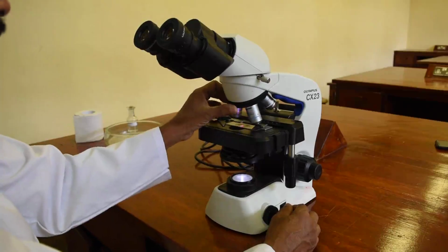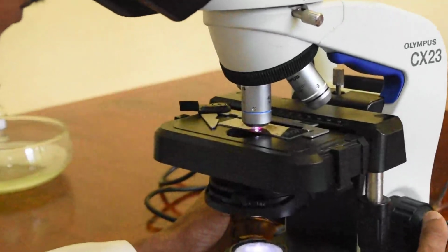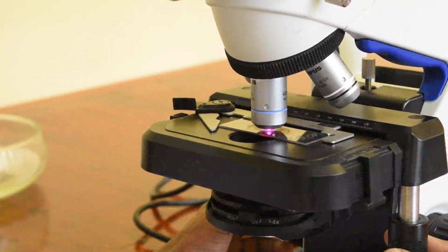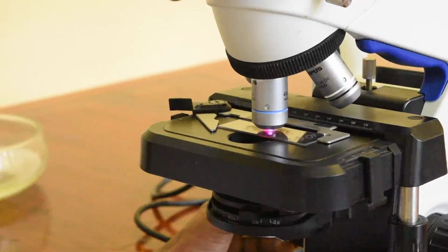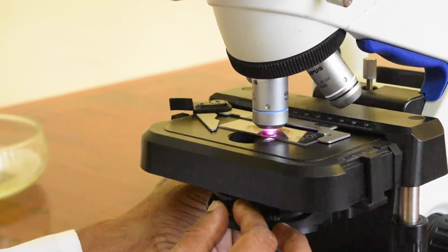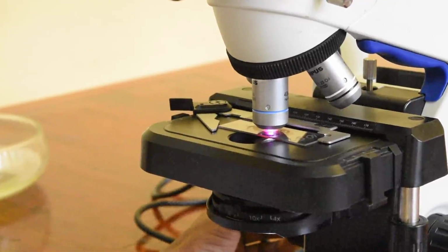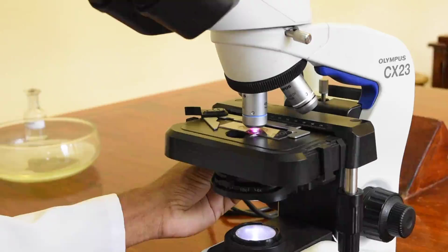So when you are putting the objective 40, now you can see there is a very small distance between the slide and the objective. So you should be very careful so as not to move the slide upwards, because if it goes and pressurizes on the 40 objective, it will damage the objective as well as break the slide. So you should touch only the fine adjustments, and you have to adjust the light also accordingly. You can see there Mr. Dharmasiri is putting the aperture in according to the objective, and the condenser is at a higher position.